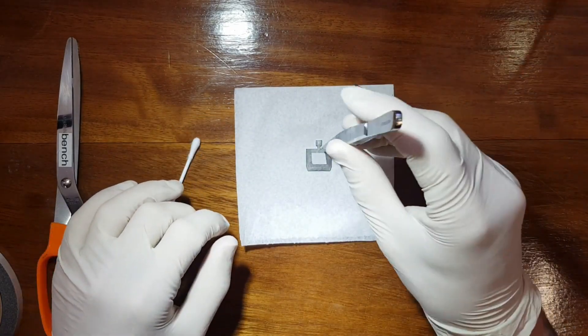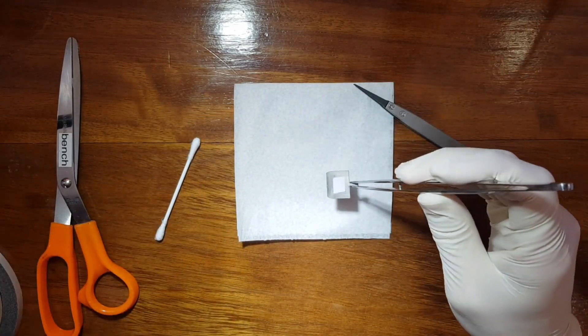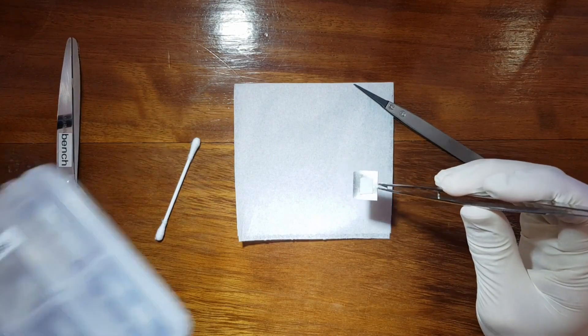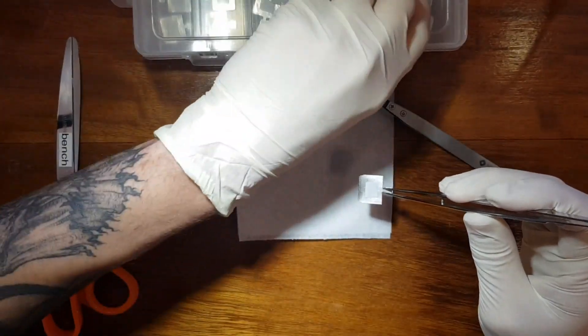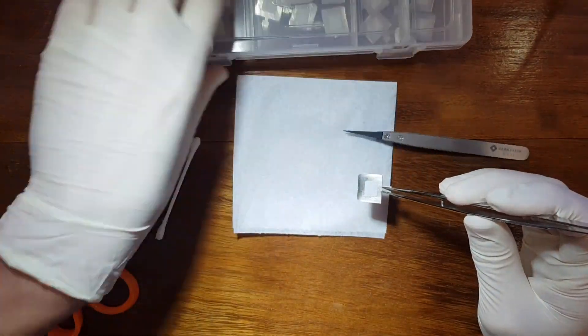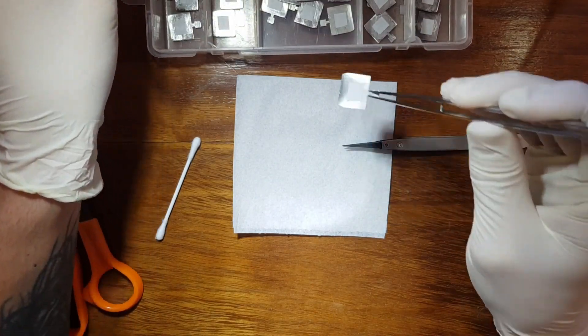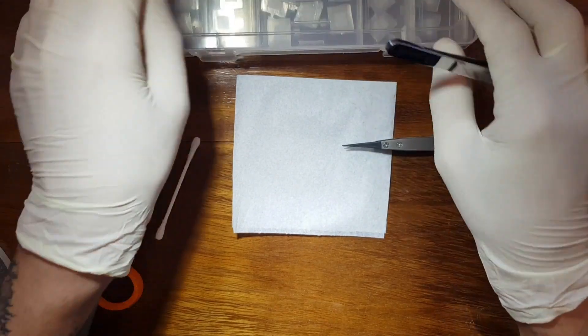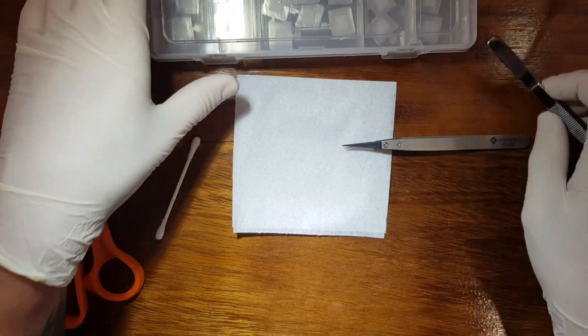I'll just gently put some pressure on here and that is our second sample holder prepped for our powder samples, which is something I'll do in another video to show you how that's done. I can just put that in there nice and safe and ready.